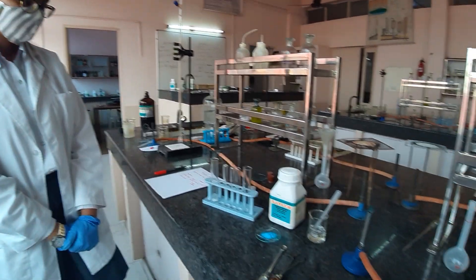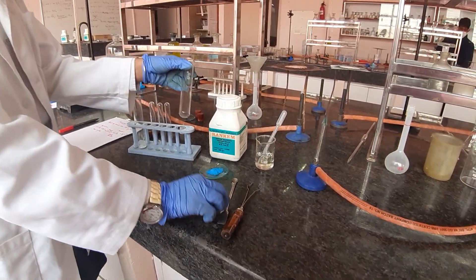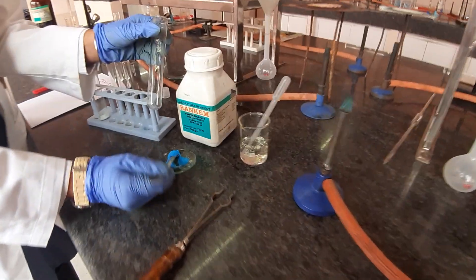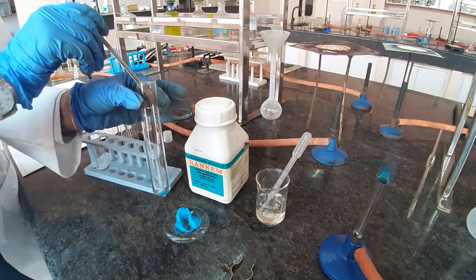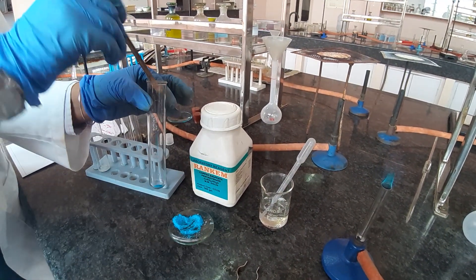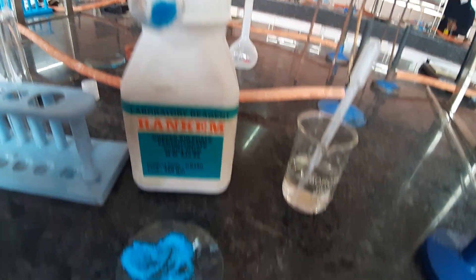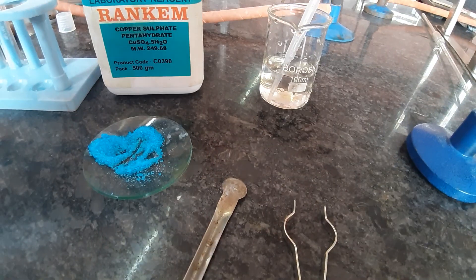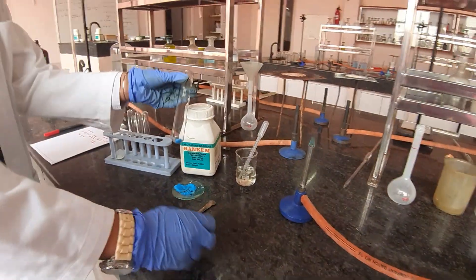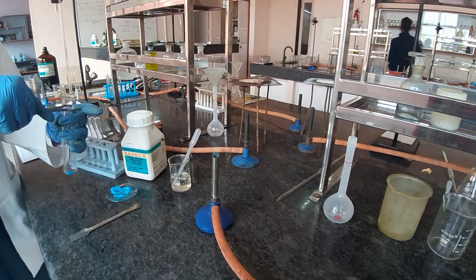She will be taking the boiling tube to which she will add a pinch or two of copper sulfate crystals. She has taken two pinches of these blue colored copper sulfate crystals, and now she will start to heat them. She will clamp it up in the test tube holder and then start heating them on the burner.